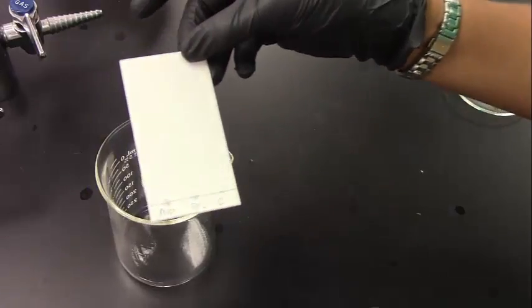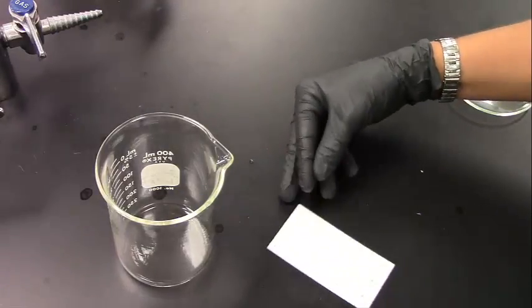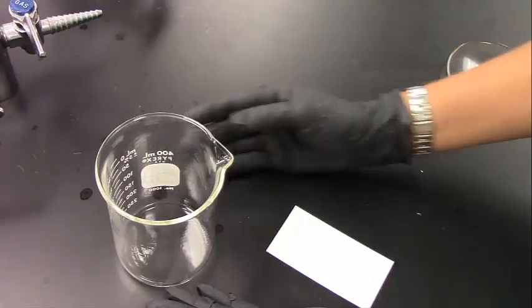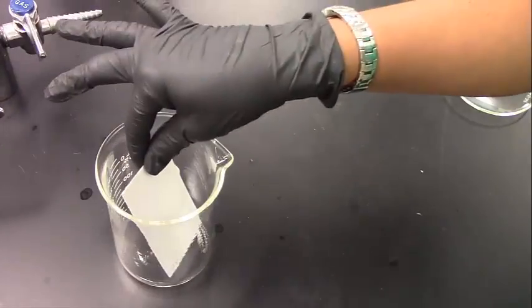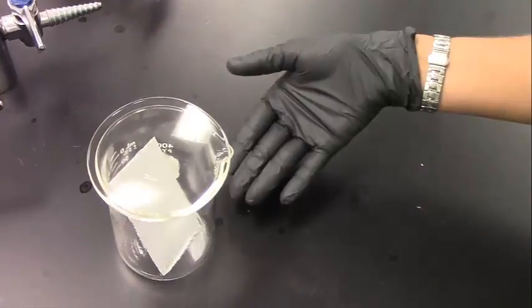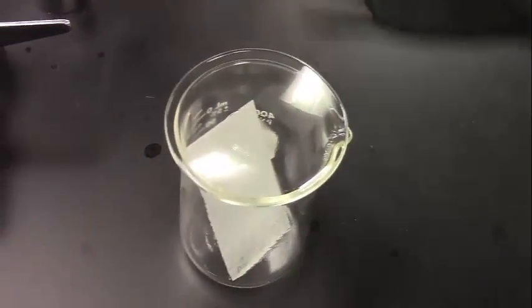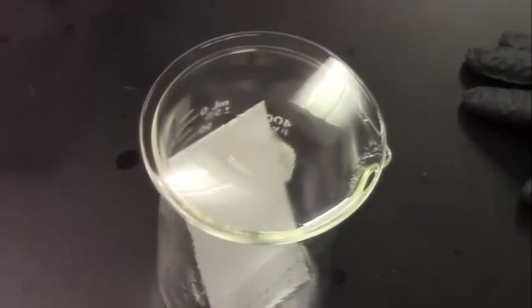You can see that the spots have dried on the TLC plate. So you are now going to put this into your developing chamber. I've added about 7 milliliters of an ethyl acetate acetic acid solvent. I'm going to set the TLC plate into the developing chamber, put the watch glass on top. You can see the solvent is rising up the TLC plate. This is through capillary action. We have the watch glass on here in order to saturate the chamber with these vapors and also to prevent evaporation of the solvent.